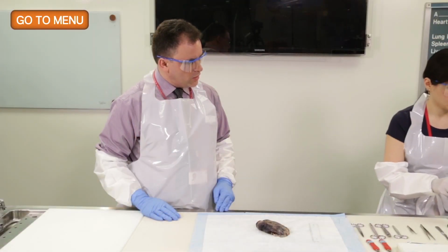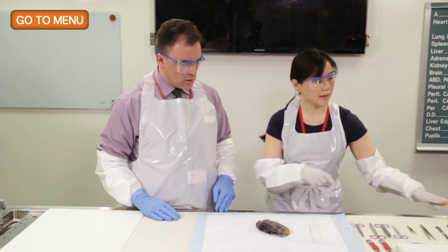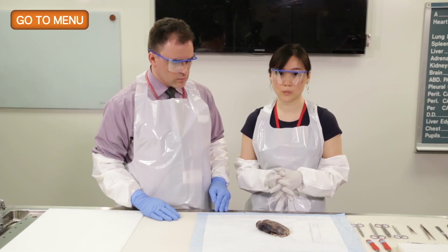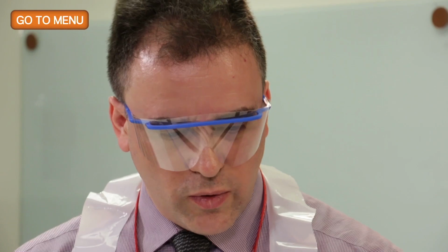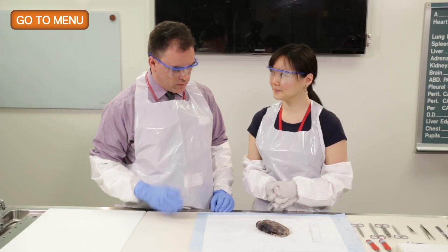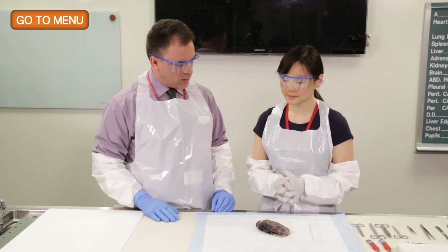And so, in addition to the size, do we generally weigh lung specimens? We do, but we usually weigh them prior to actually fixing it in formalin because it'll change the weight. So for this exercise today, we fixed the specimen largely because of the ease with which we would be able to then do this presentation without face mask. But nevertheless, normally we do this in the fresh state. So what would you like to look at next?